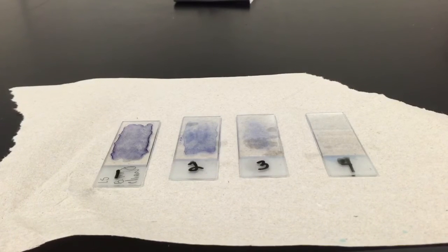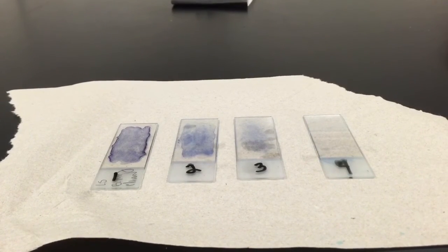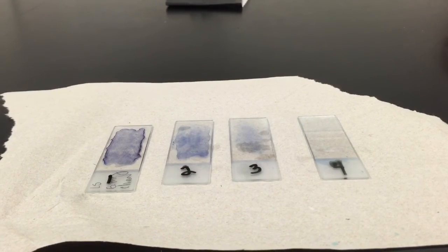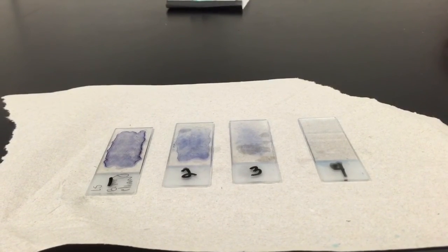So I will take a look at these with a microscope in a bit and if I have time, I will upload photos. All right guys, thanks.